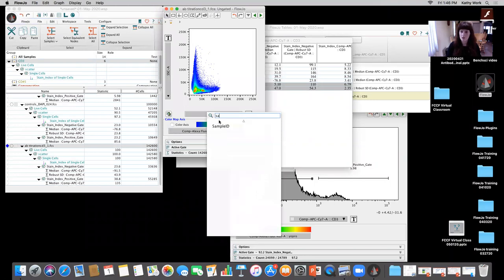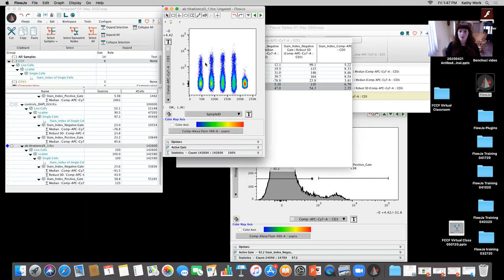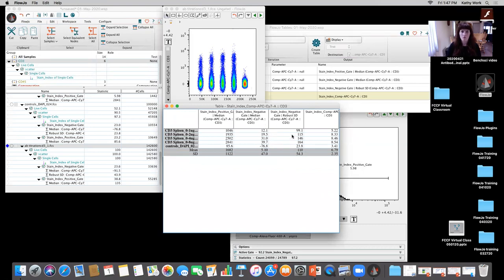On the x-axis, I'm gonna change it to sample ID, and on the y, I'm gonna change it to CD3, okay? So what we're seeing is the CD3 positives are continuing to go up, and you're not really seeing much of a shift up or a significant spread of the negative, okay? We always want to rely on the statistics, not on visual inspection, to choose antibody concentration when we're doing titration. And this is a good example of a couple of different things. It's an example of controls. It's an example of not having the appropriate starting concentration and dilution range. And also why we wanna make sure that we include a vital dye potentially if there's a lot of debris, okay? So that's a titration example.